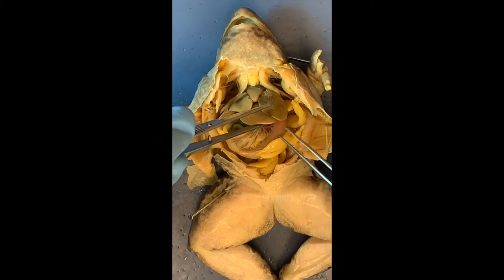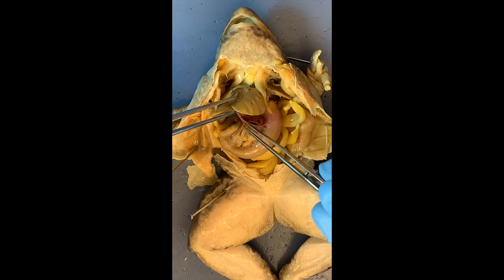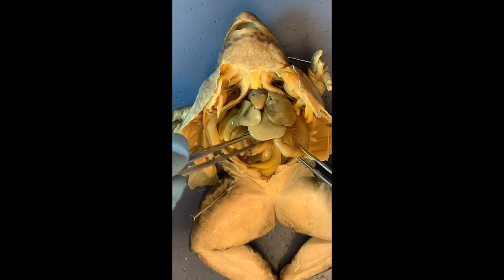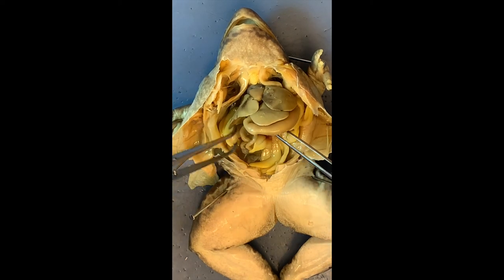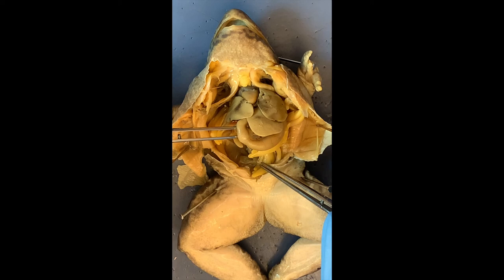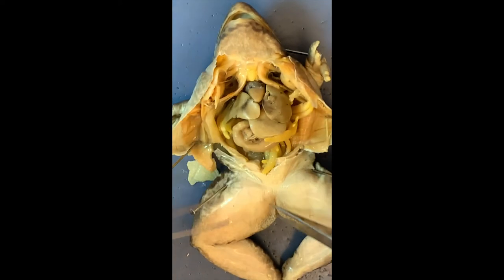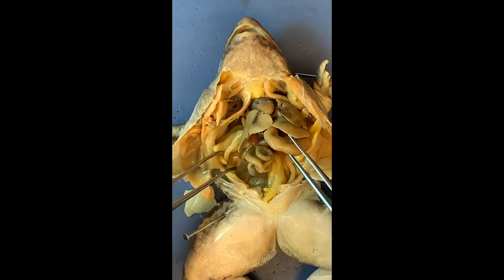Then we see the stomach right here — a big, J-shaped organ, with all the blood vessels. And then it becomes the intestine. Following the wiggly intestine, you see the last part — it's larger. So small intestines come first, and then the large intestine, which is wider. Then it gets to the anus, which is in the back between the two legs. I think we saw most of the important organs here.